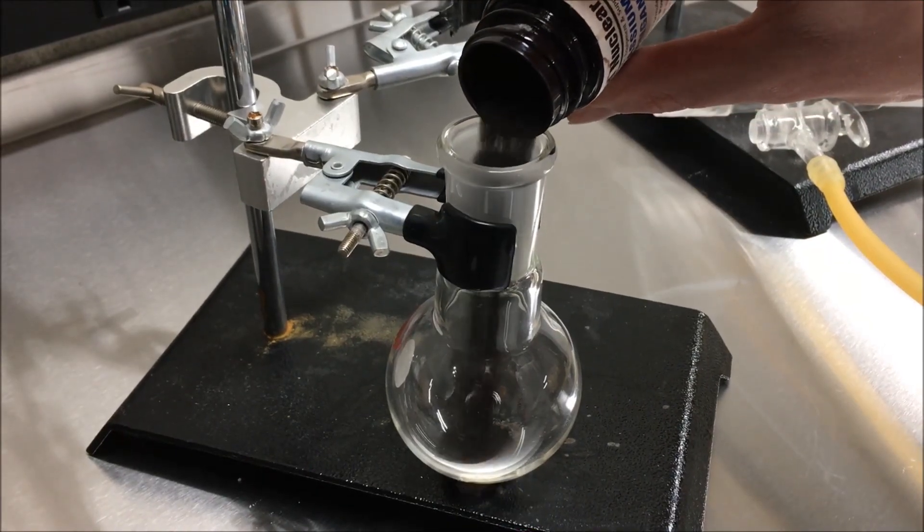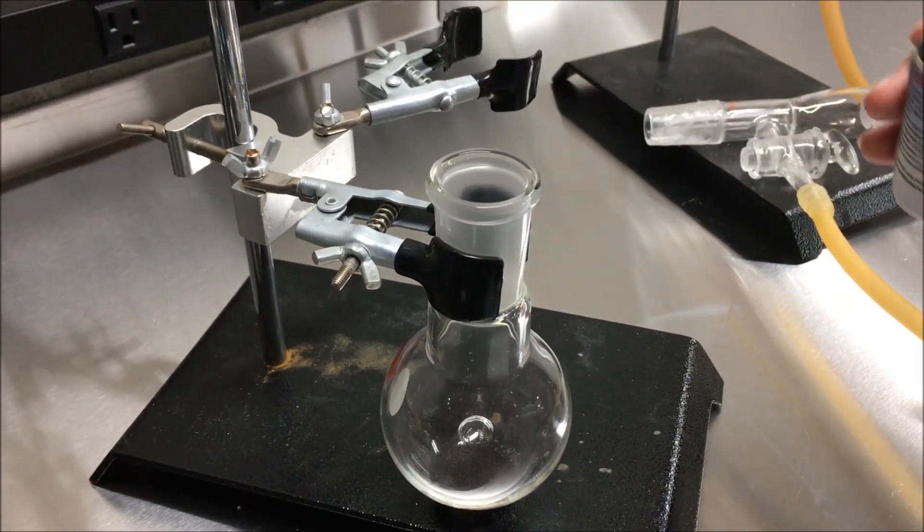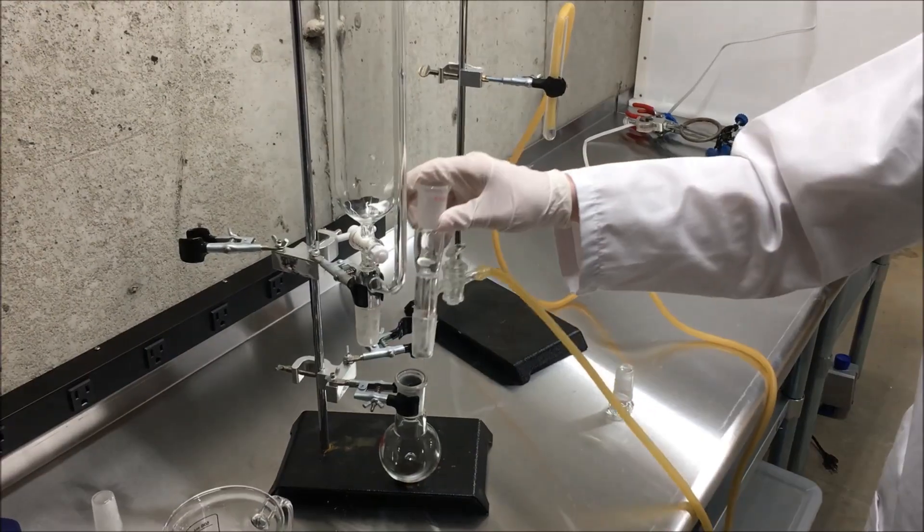I started off by adding a small amount of potassium permanganate into a flask. I did use way too much.